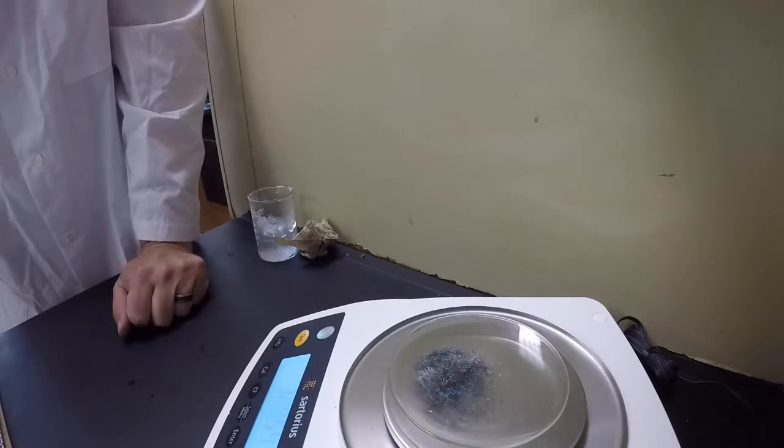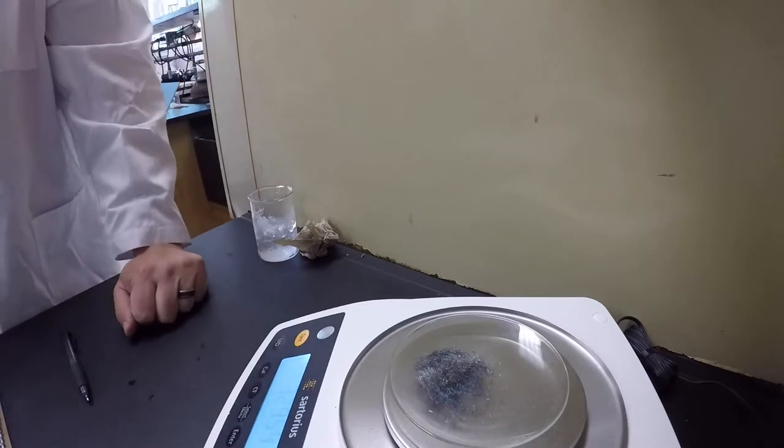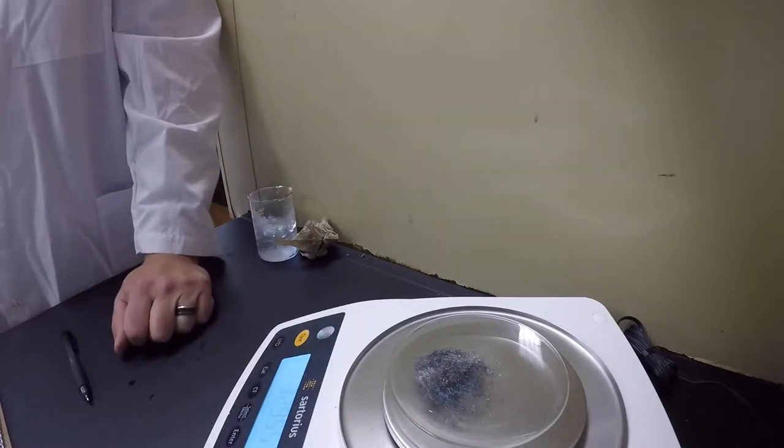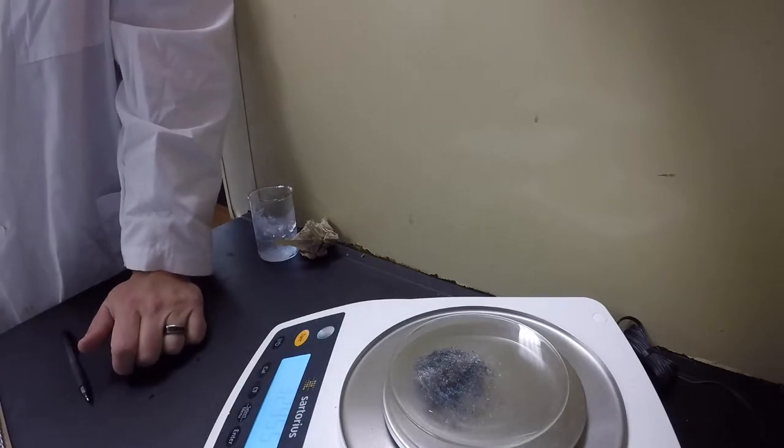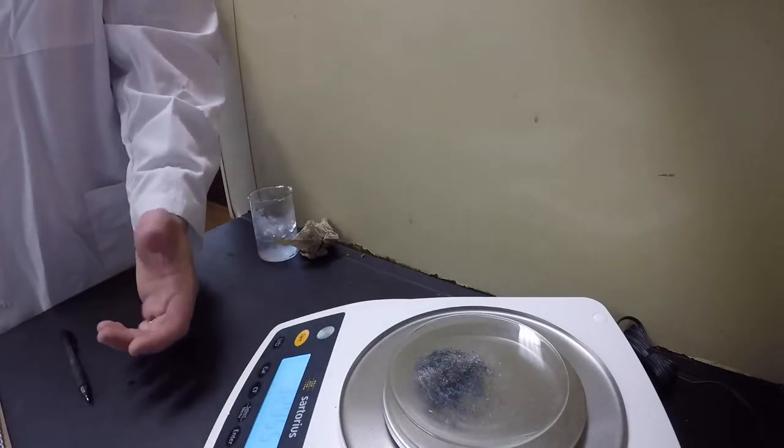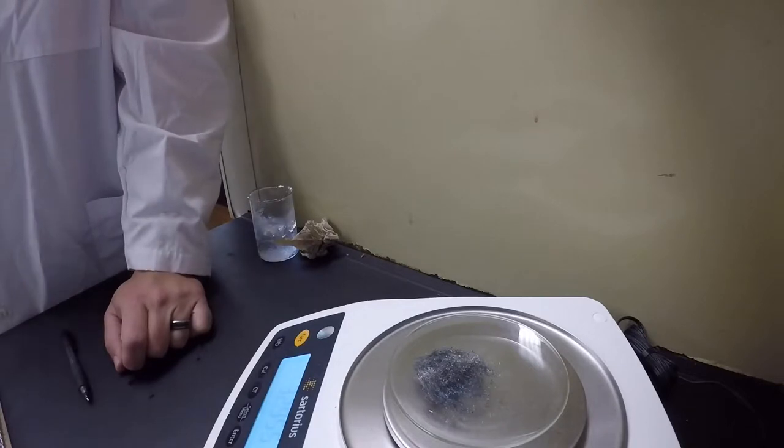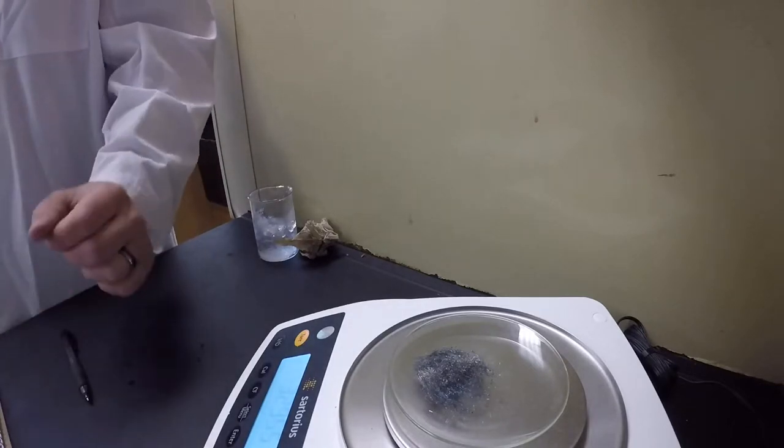So we actually had a slight increase in mass. So it feels like it's cooled down, everything's nice and cool, so the mass has increased a little. So where did our extra matter come from? Because we've already determined that matter, we're not gaining mass in any of these and we're not losing mass. They should be about the same.